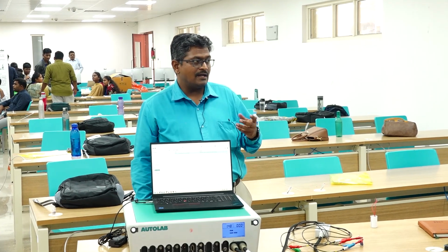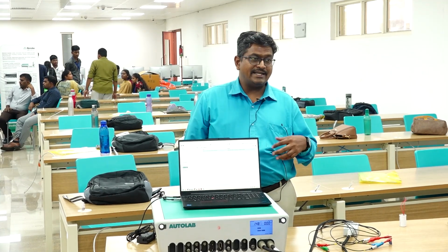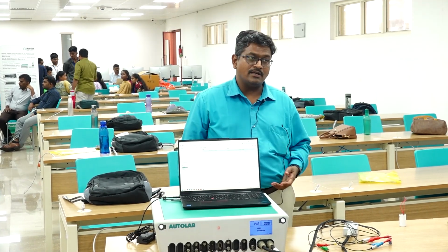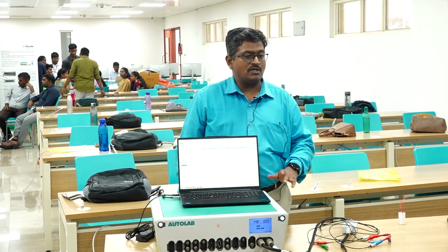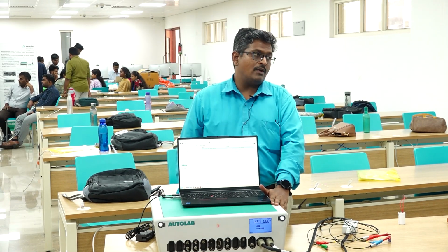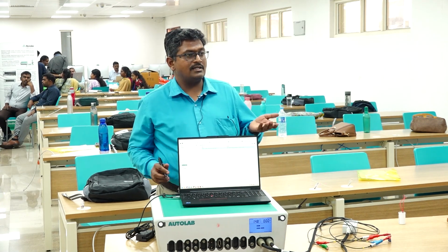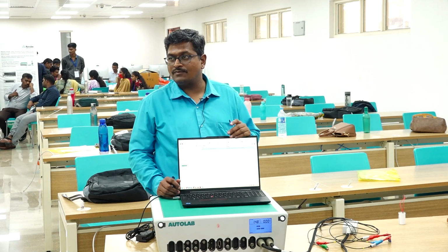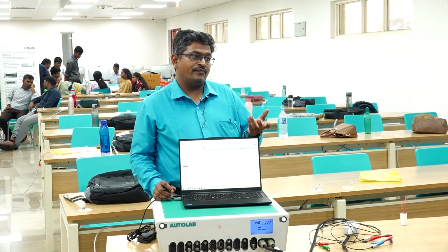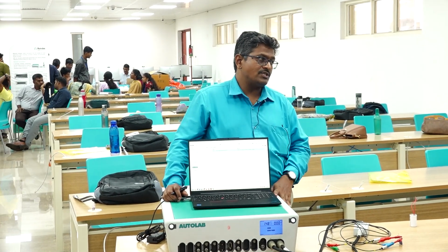The color is not a matter, but the pigments or the chemical composition of your paint, that takes care of your corrosion. They are called inhibitors, corrosion inhibitors. So people are studying many such researches with the same electrochemical workstation. Normally for batteries we are seeing CV, EIS as well as galvanostatic charge discharge. But in case of corrosion, we will be doing LSV and EIS mostly, and then pitting corrosion. All these parameters can be analyzed with this electrochemical workstation.